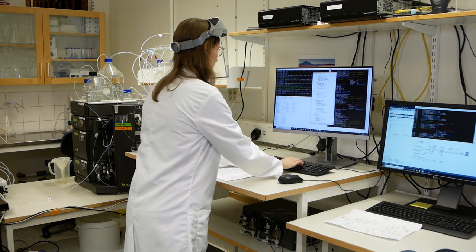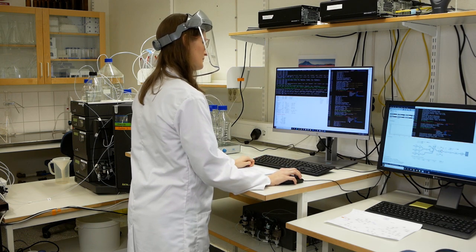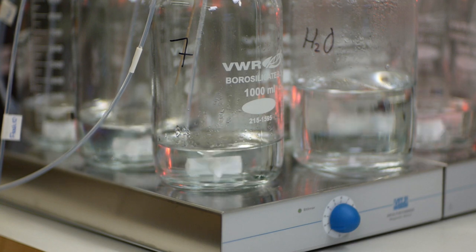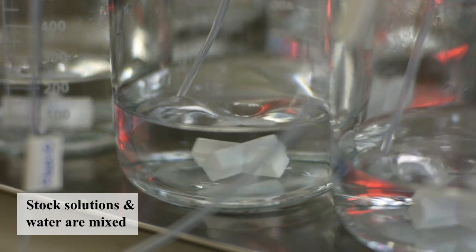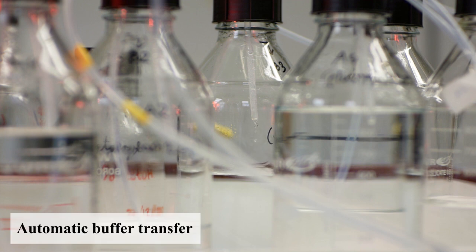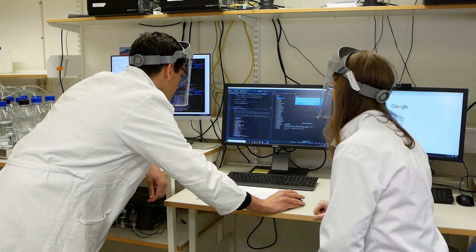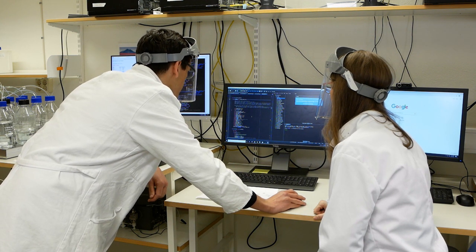The buffer management system monitors the buffer volumes and prepares fresh buffer when needed. Buffer is prepared according to predefined recipes by mixing stock solutions with water. After the buffer has been prepared, it is transferred to the correct buffer flask. The operators can easily make adjustments in the Orbit software, if necessary.